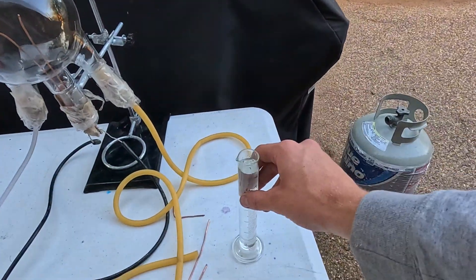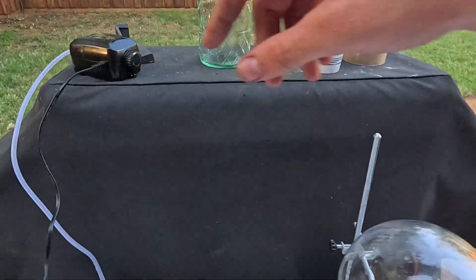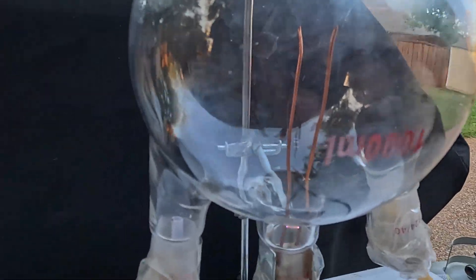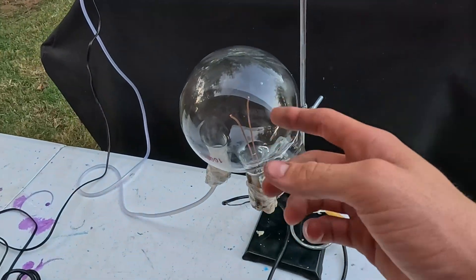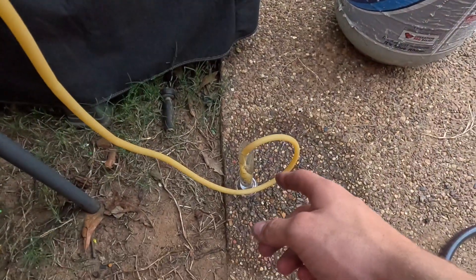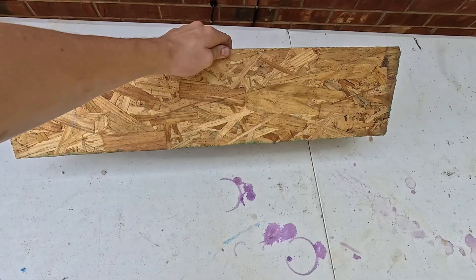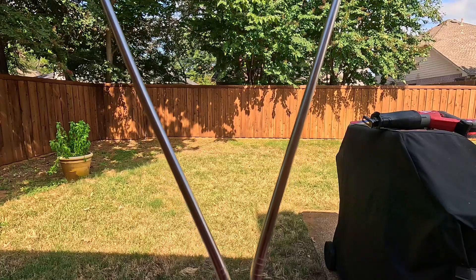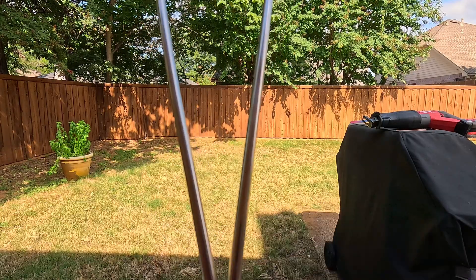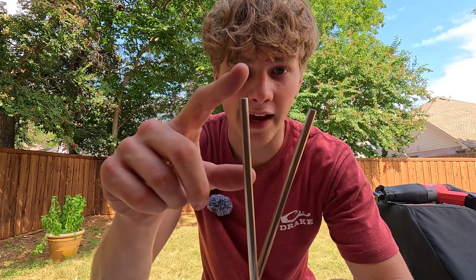Now let's connect the pump and our water supply. Instead of the mason jar, it's better to have something tall and thin, so I've replaced it with a graduated cylinder. We have our pump running and it is arcing properly, with everything coming down into a little solution of water. To make this way simpler, we're just going to replace the setup with a piece of plywood, two metal straws, and a mason jar. Not only do these straws act as our copper wire, they also act as our tubing making this impossible to leak. So now the air comes into one straw, arcs up at the top, and exits through the other, making the system ten times easier.